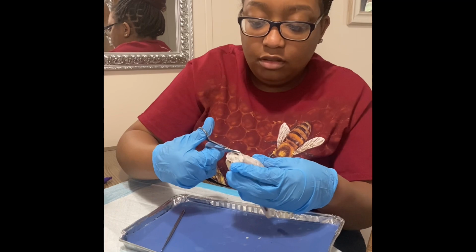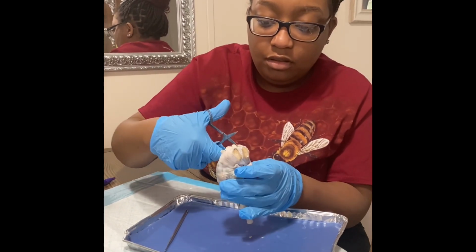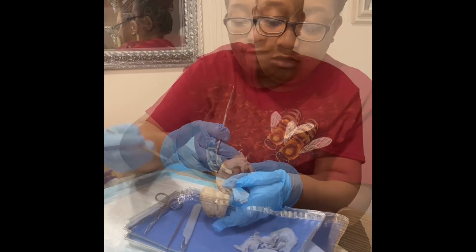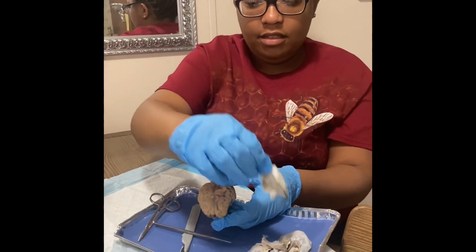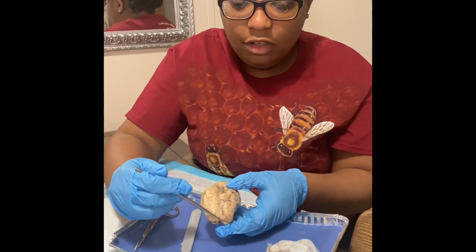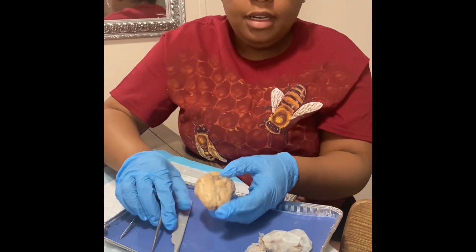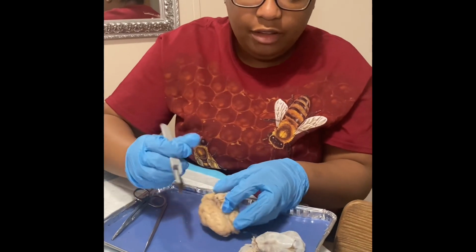This is what protects and supports the brain. I've gotten all of the cranial meninges off. So as stated earlier, you can see a better view of the longitudinal fissure, which is this deep groove that goes right here down the cerebrum. Now I will do a mid-sagittal cut right through the middle.